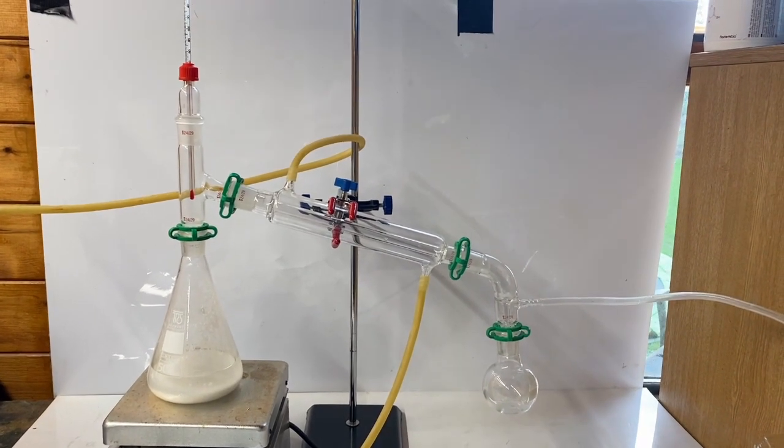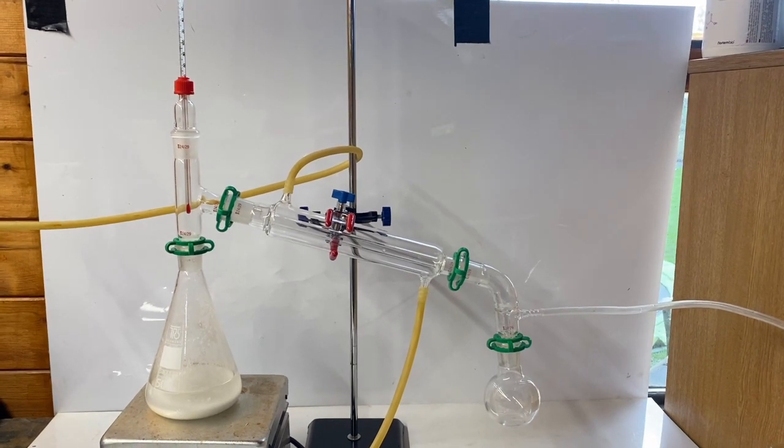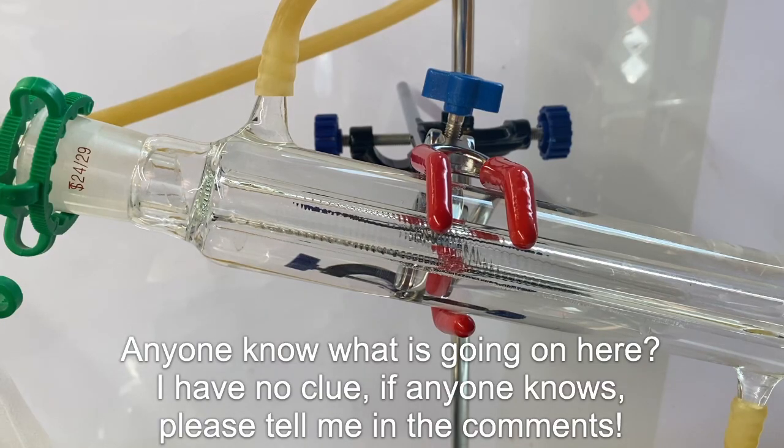Next, a simple distillation was set up. This was to remove the trimethyl borate from the sodium sulfate and water mixture.